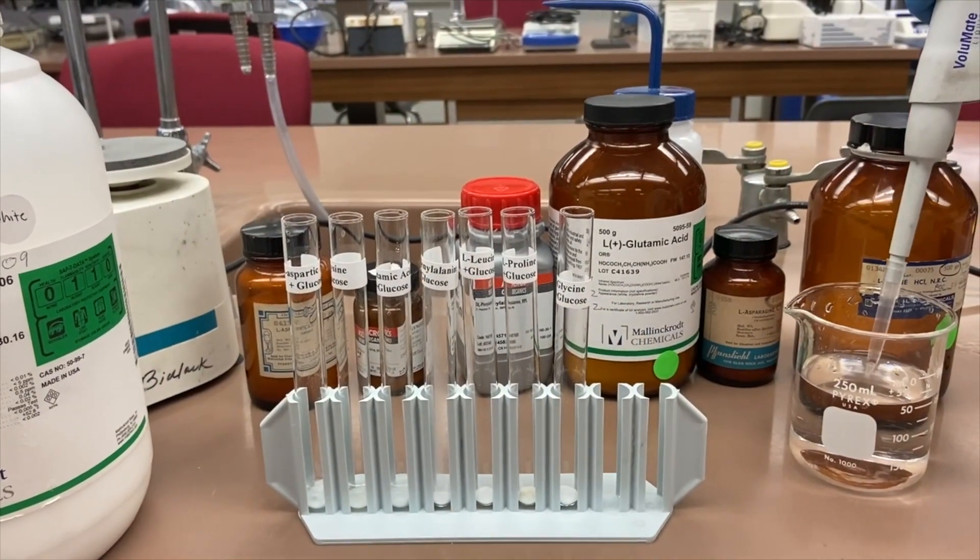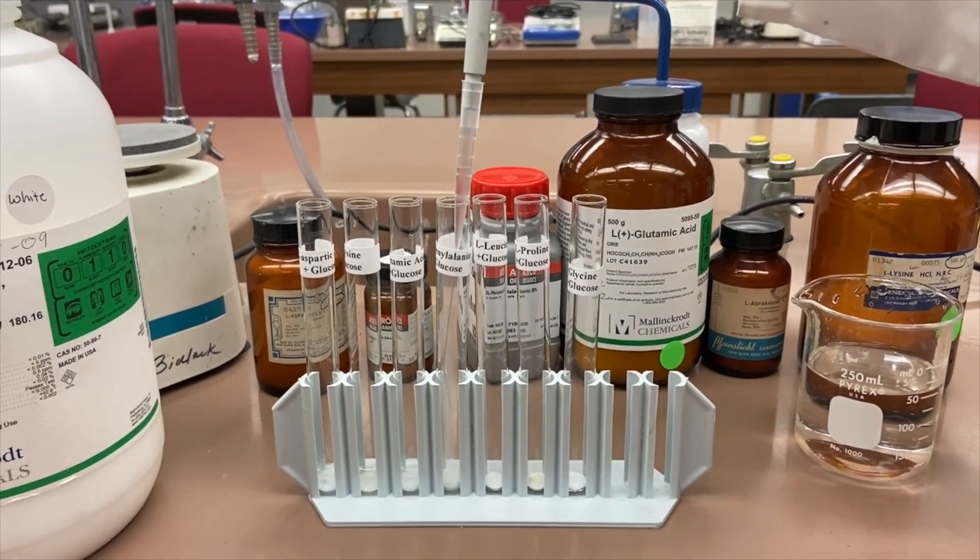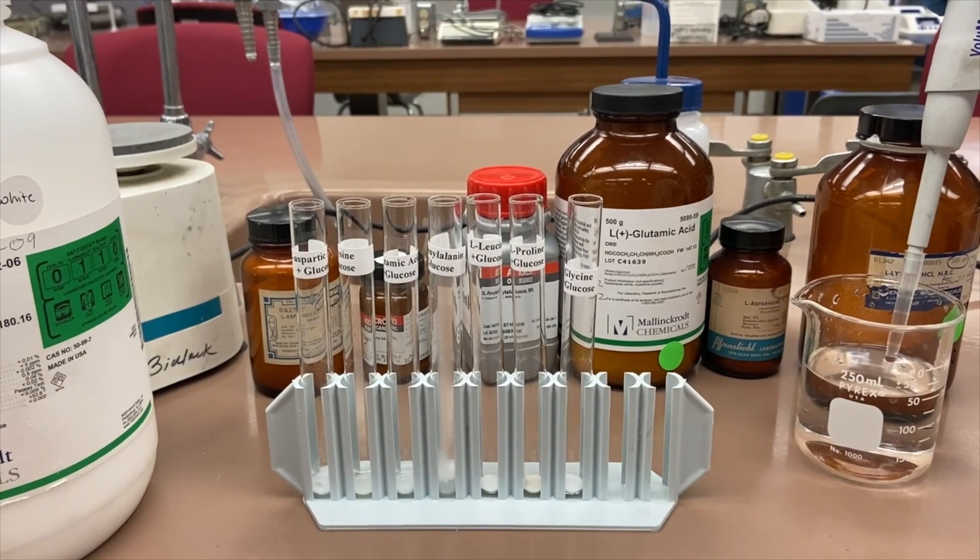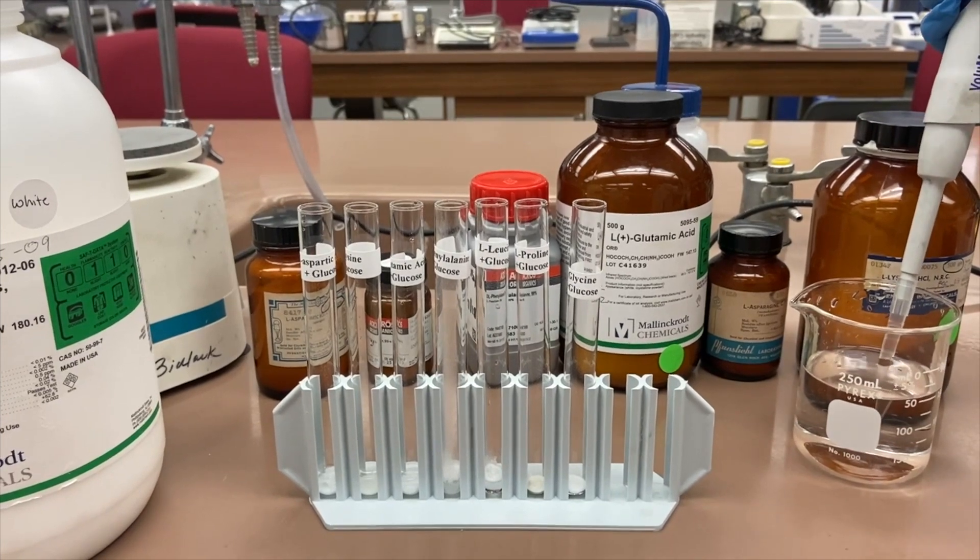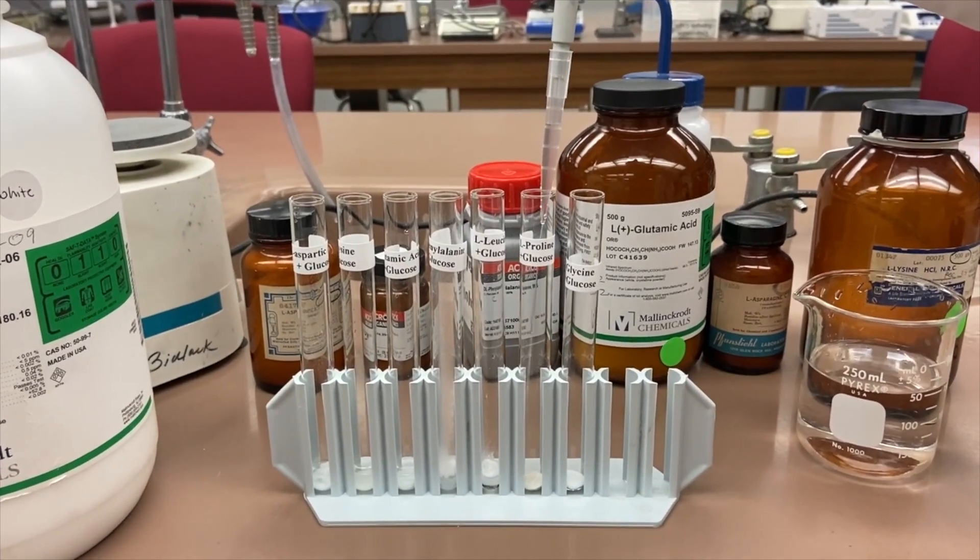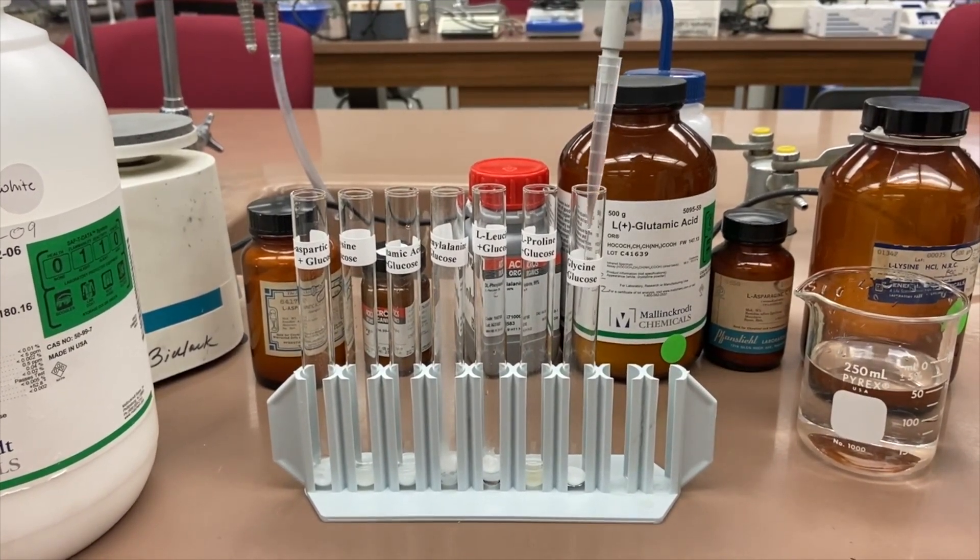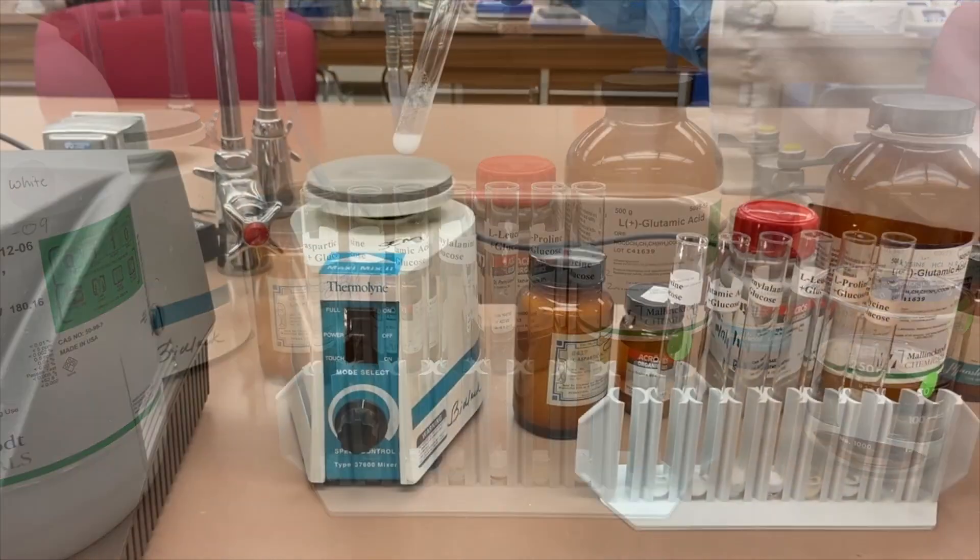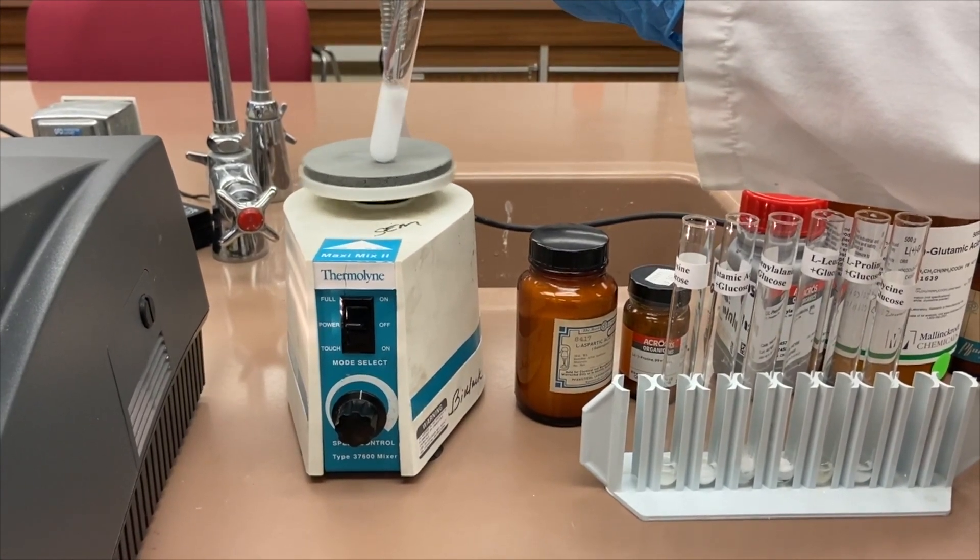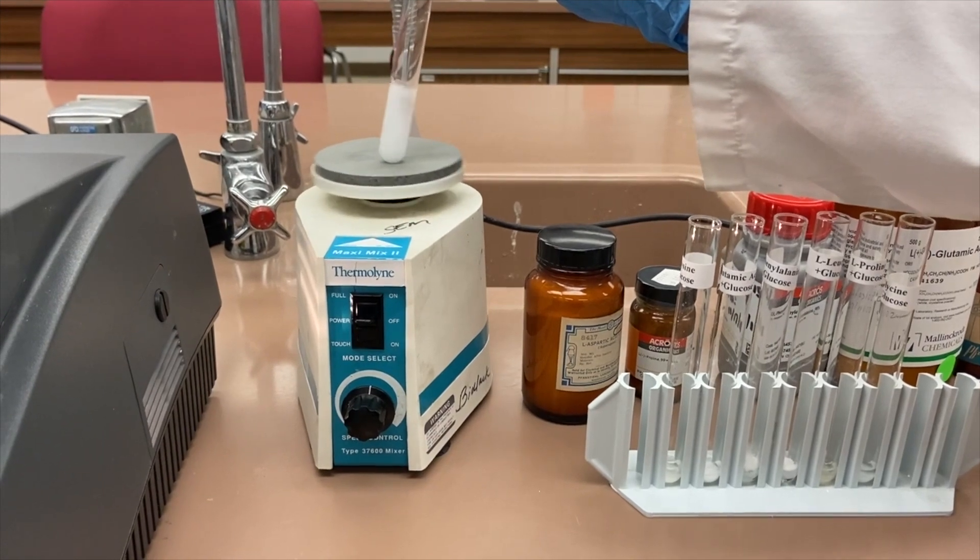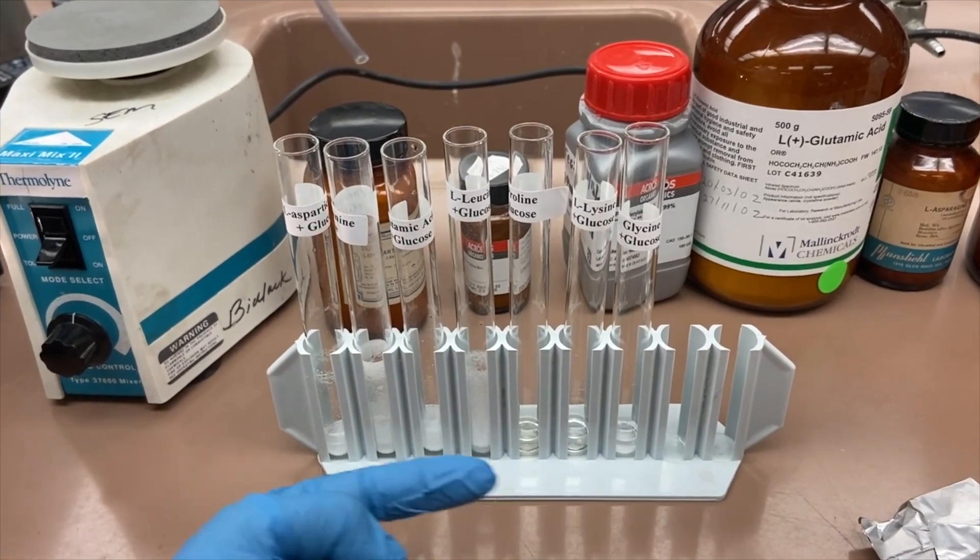Right now I'm adding 1 milliliter of water into each test tube. I'll be using the vortex to mix each amino acid with glucose. I just mixed each test tube and initially I don't smell anything.